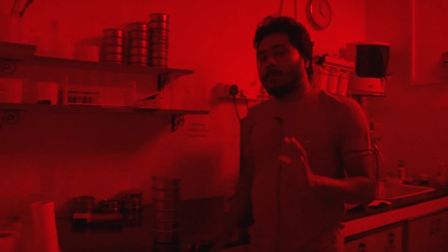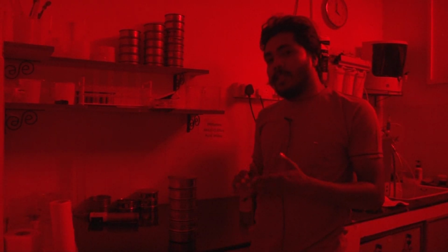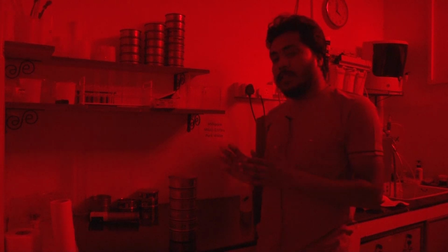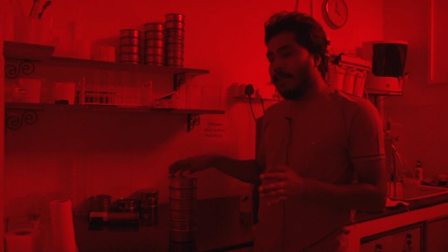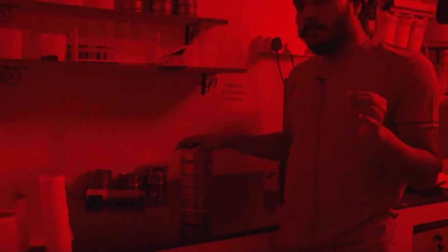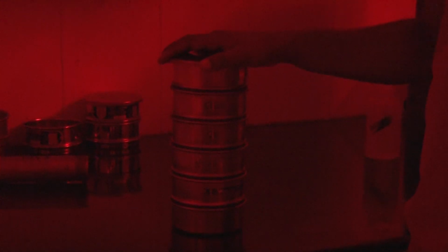After your sample is dry, we will go for the sieving part. As I was discussing, for coarse grain dating you basically use 63 to 250 micron. Here in this lab we will use 90 to 212 micron, and for the dating part, because our reader is calibrated with 90 to 125 micron, we will use the 90 to 125 micron sand size. To get the 90 to 125 micron, we will do the sieving.